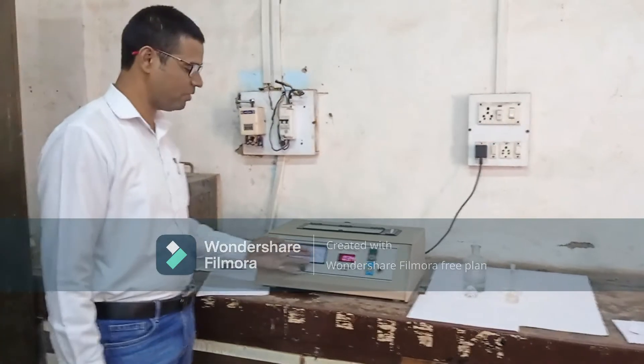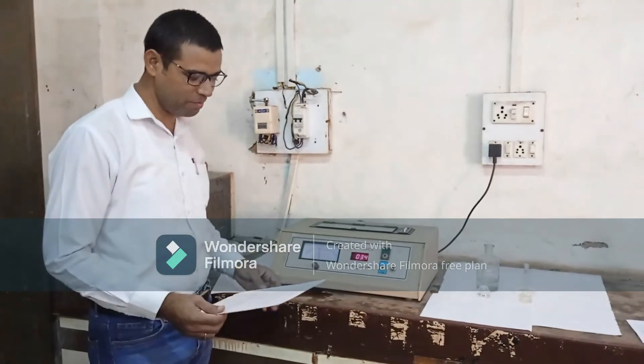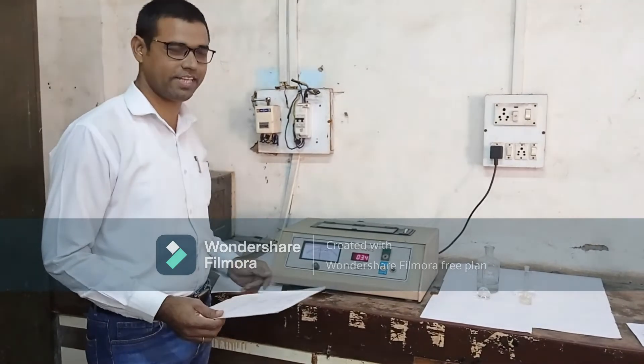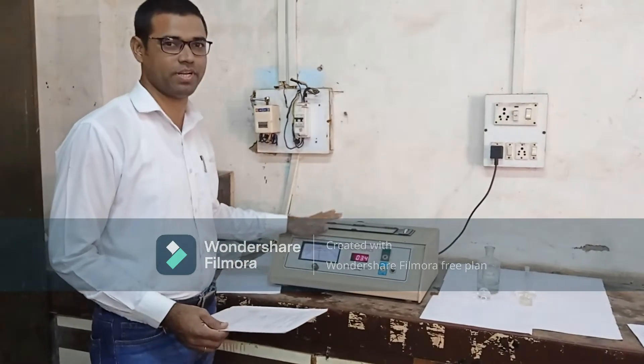Hello friends, today we will work on the practical on the polarimeter. The aim of our practical is to study the kinetics of inversion of cane sugar by using this polarimeter.